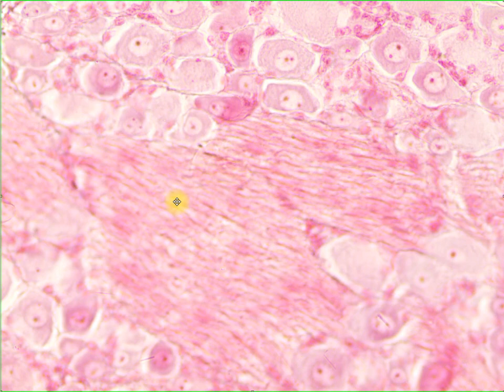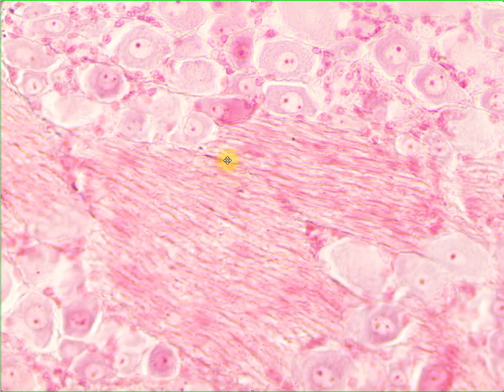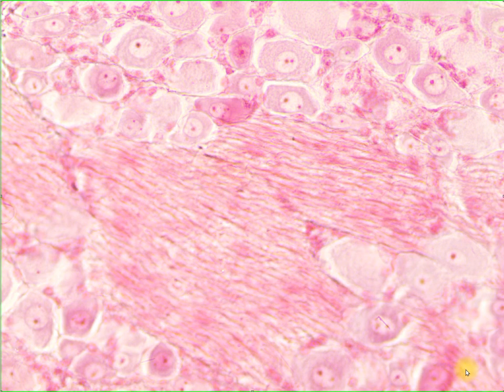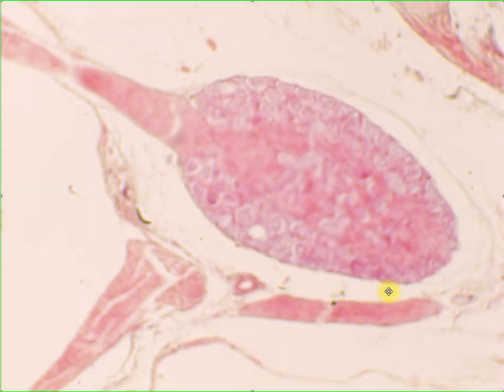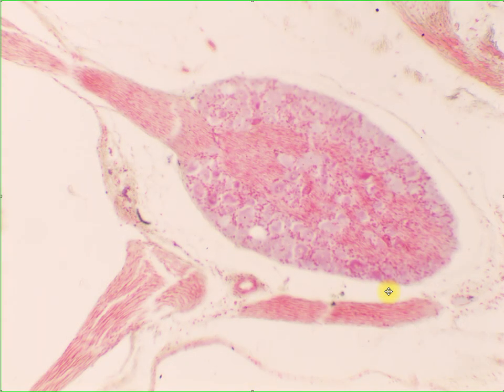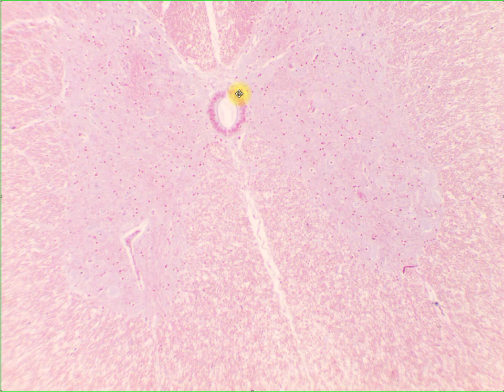And here, this is a longitudinal section of the axons. Okay? The darkly staining pink structures are most likely your axons. So this is part of your peripheral nervous system. If we go back into the spinal cord, then we will be talking about your central nervous system.